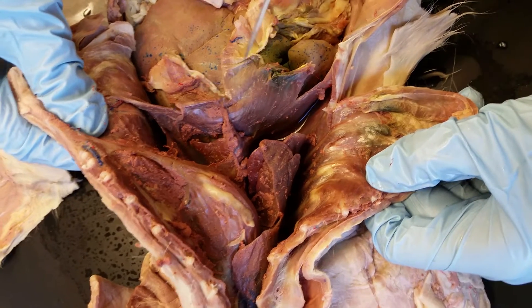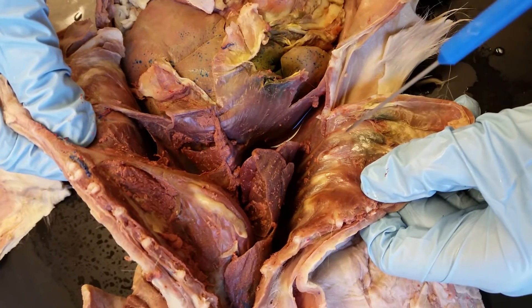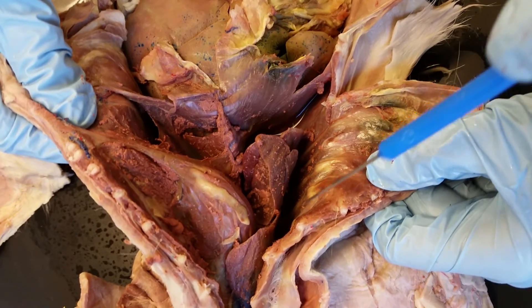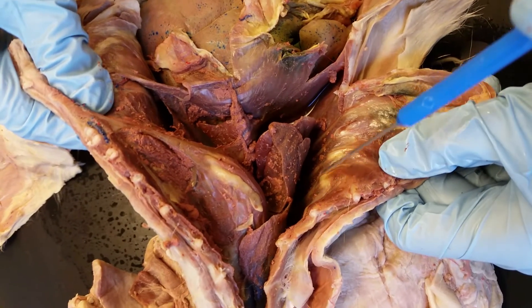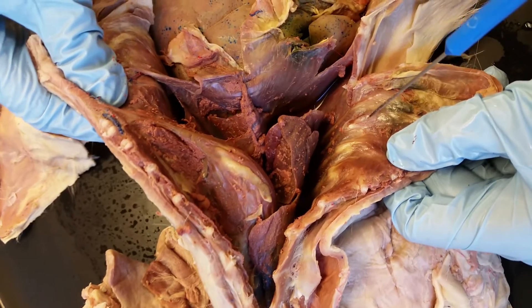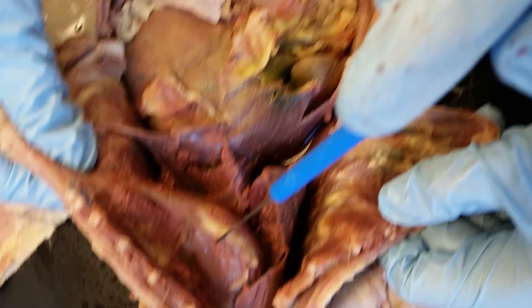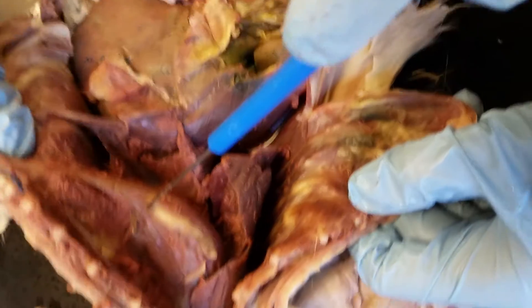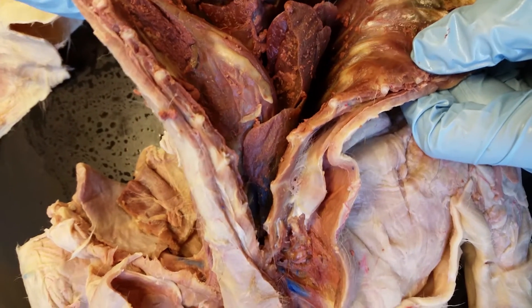We are looking in the thoracic cavity of the cat. This lining right here along the body wall is the parietal pleura, and then this is his heart right here, covering the heart.